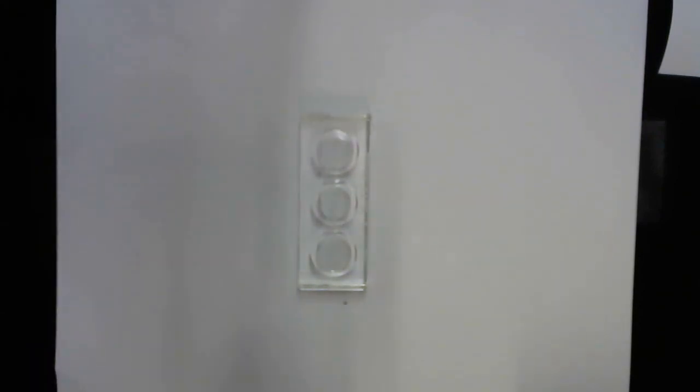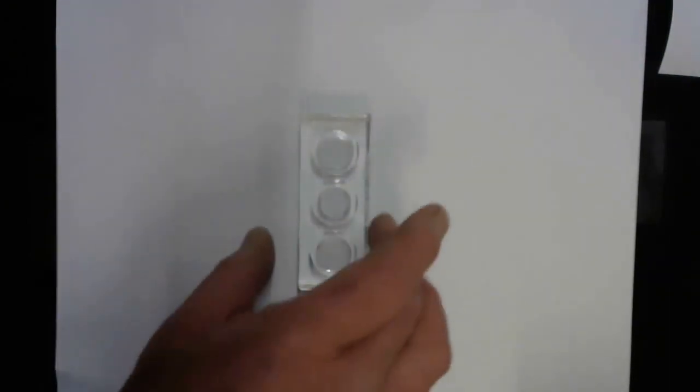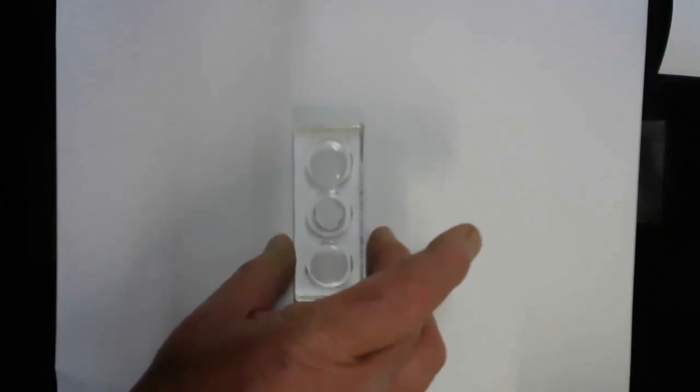And this is hard to see in this, but there's bubbles forming. I'm going to repeat the experiment in a test tube where we can see larger volumes. But I think, wait a minute, no, it's pretty tough to see the bubbles in this volume. Okay, we're going to do the experiment one more time with a test tube.